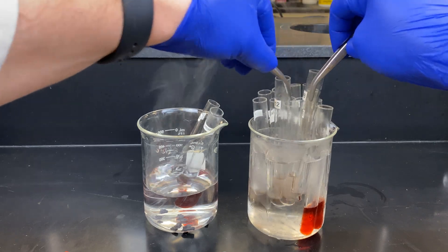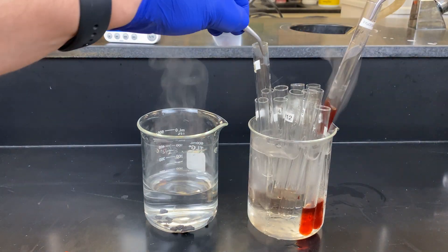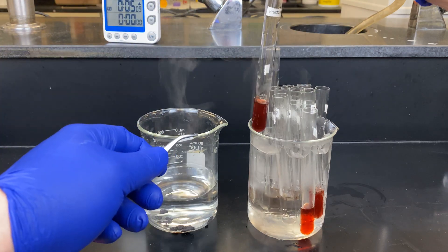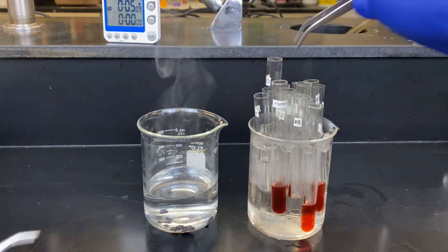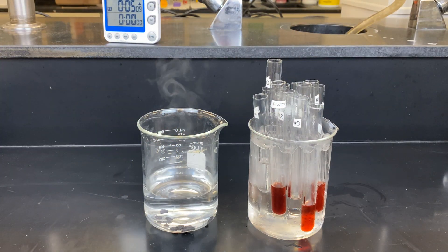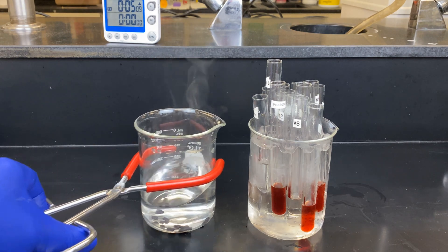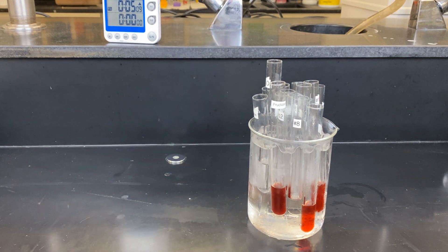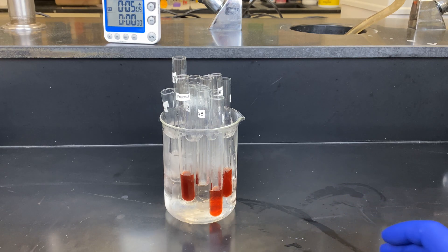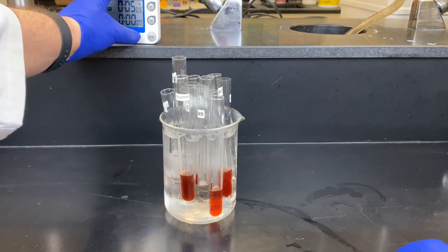You can definitely see some cherry red samples and some peach samples. Once again, ketoses will be cherry red, whereas aldoses will appear peach in color. I will let this sit for a few minutes before we analyze it.